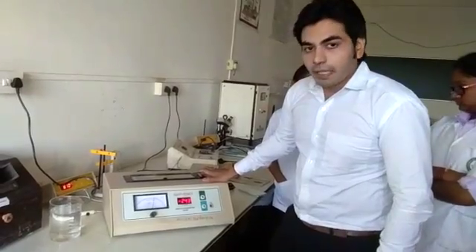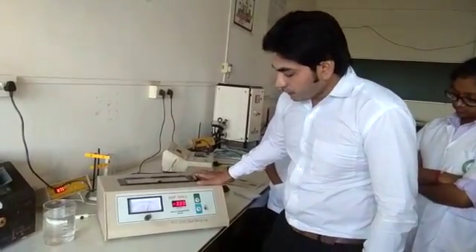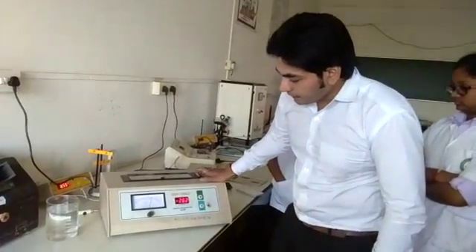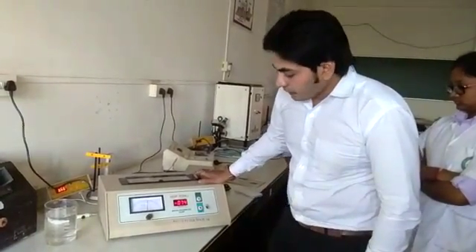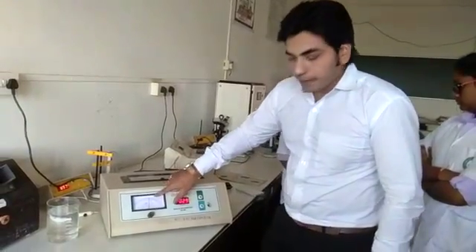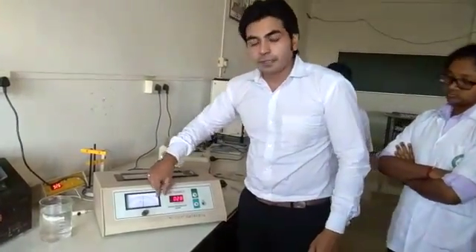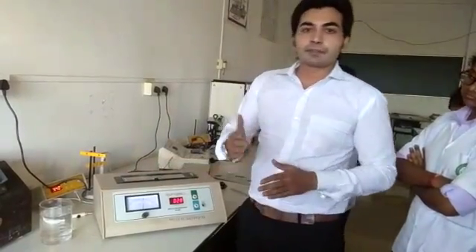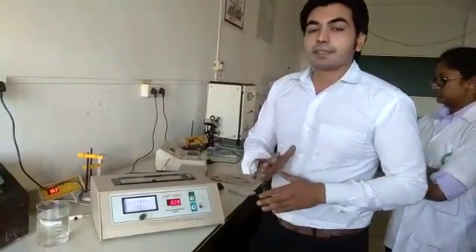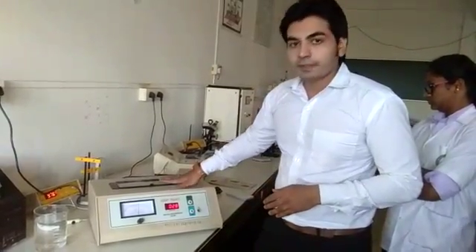Rotate up to an approximate value, then after reaching a certain value, rotate the intensity meter towards the minimum side. When the intensity meter is moving from maximum to minimum, there is an automatic fluctuation of the intensity meter, and that is nothing but the final optical rotation of your sample.